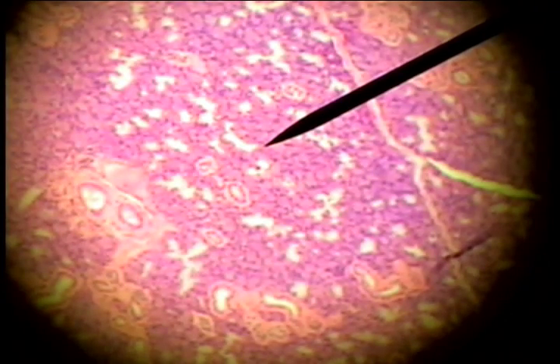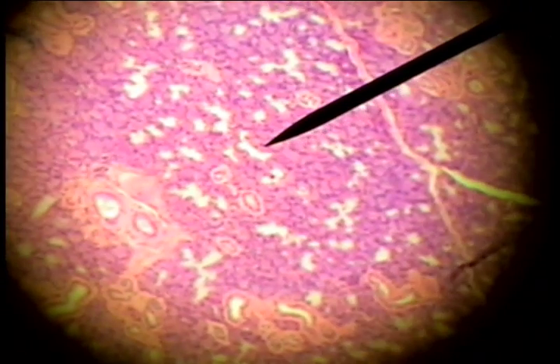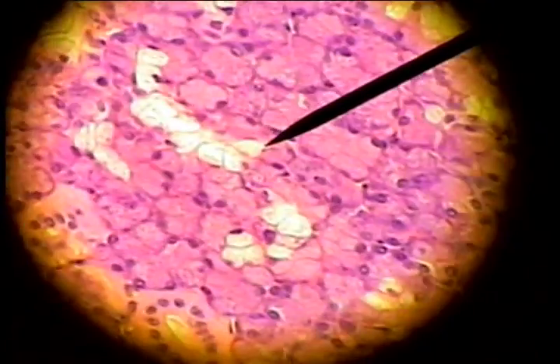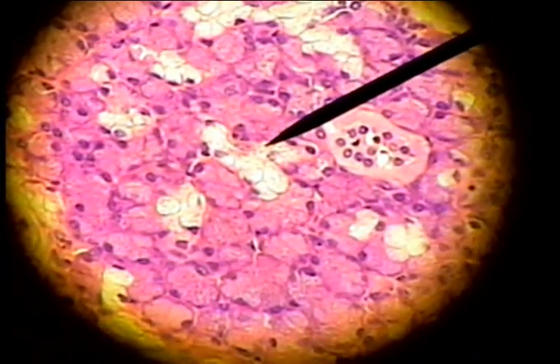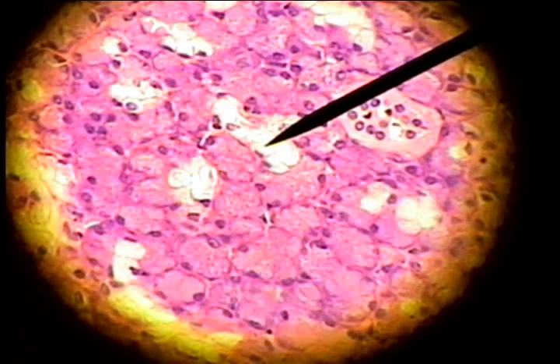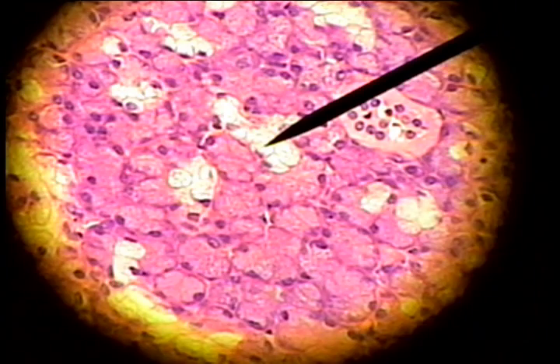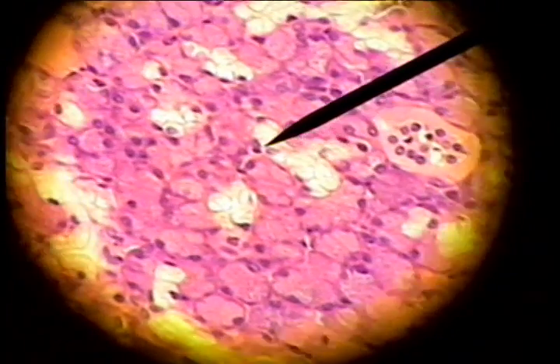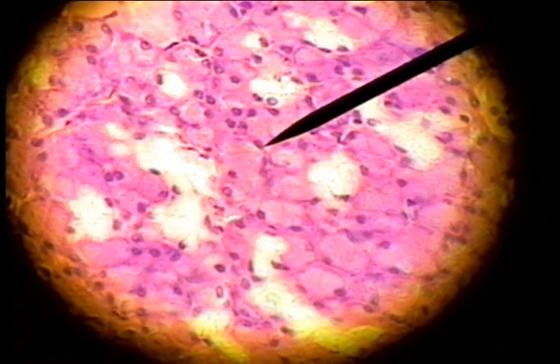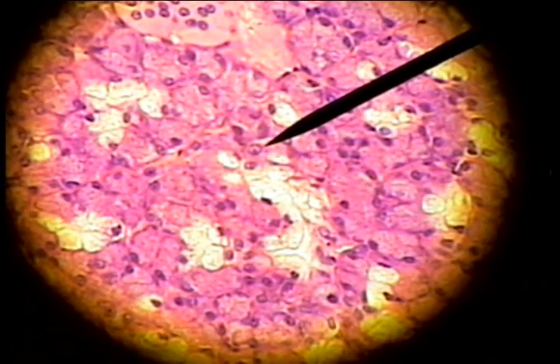This salivary gland organ has two different functional gland cells. The lighter colored cell is a mucus-producing cell, which usually has a flat nucleus on the side of the cell and whitish vacuoles in it. The dark cells usually have an oval nucleus and are serous-producing cells.